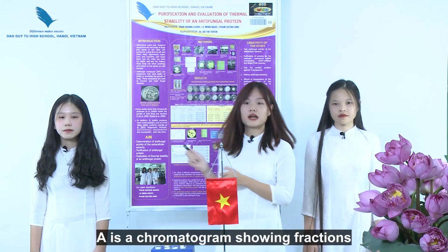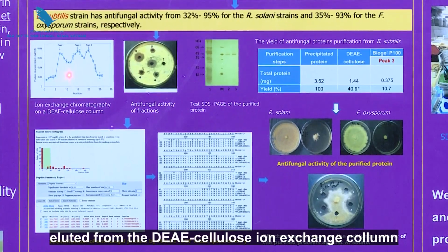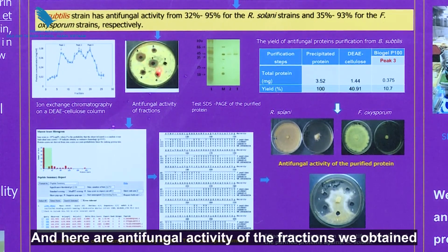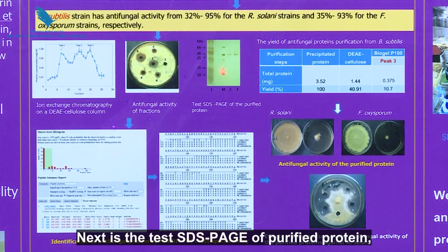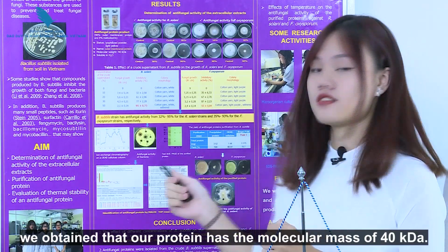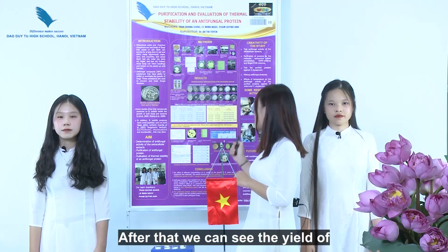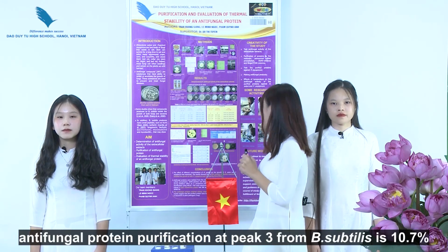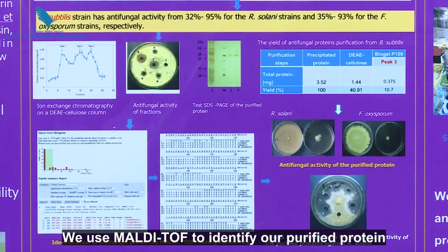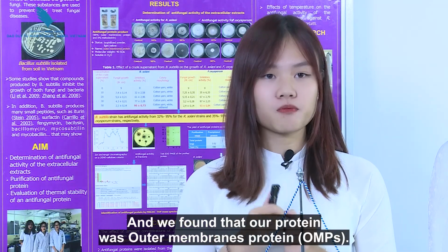A is the chromatogram showing the fractions eluted from the DEAE cellulose ion exchange column. And here is the antifungal activity of the fractions we obtained. And next is the SDS-PAGE test of the purified protein, and we found that our protein has a molecular mass of 40 kDa. After that, we can see the yield of antifungal protein purification from Bacillus subtilis is 10.7%. We used mass spectrometry to identify our purified protein, and we found that our protein was an outer membrane protein.